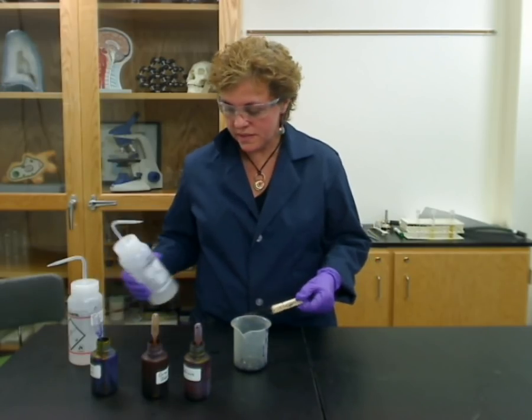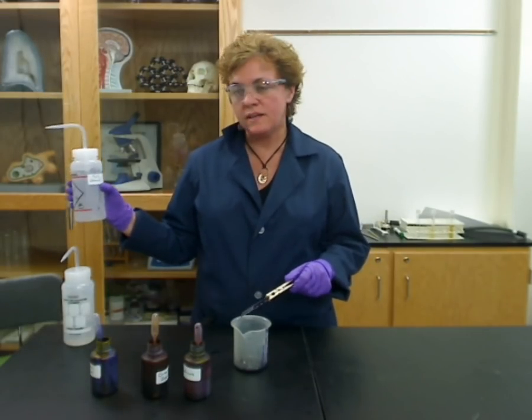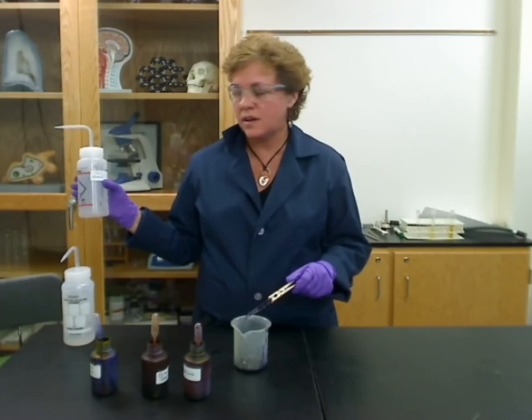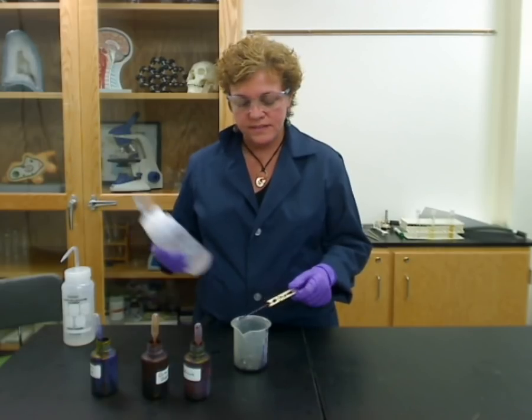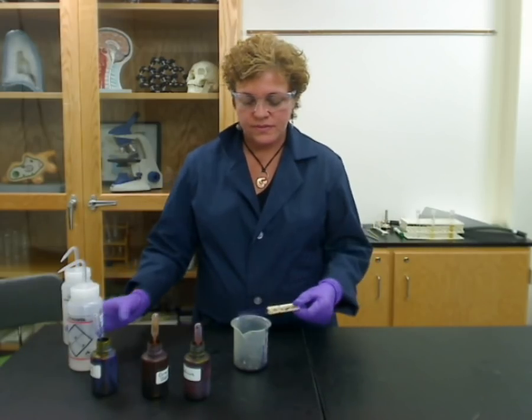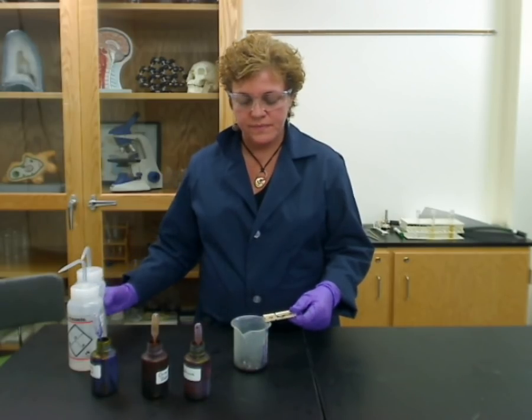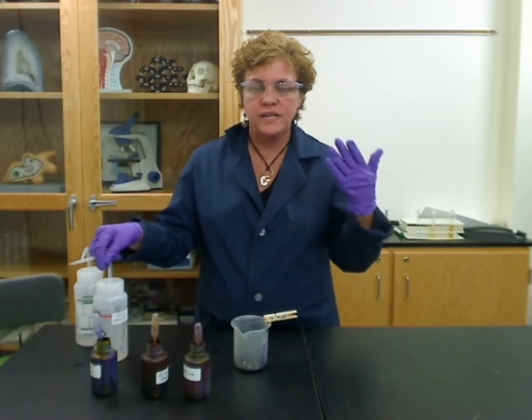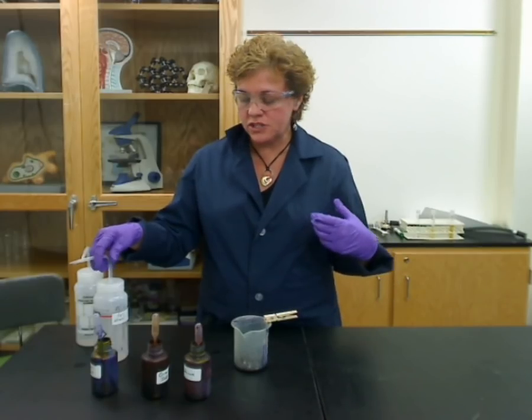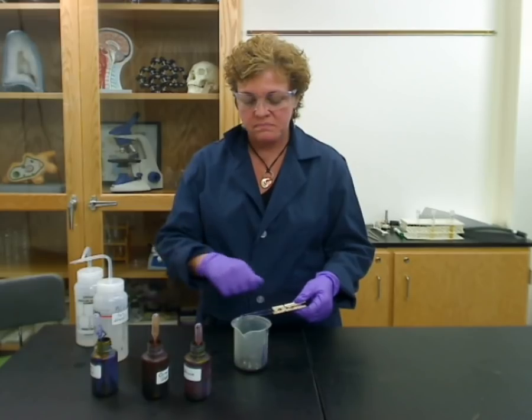You need to get rid of the iodine, rinse it well with water, and probably the most important step is the decolorizer. In this case we're using 95% ethanol. You can also use a combination of acetone and ethanol. You have to put a few drops on until the purple goes away, but just barely, and then rinse it quickly with water. It's really important that you don't use too much decolorizer, because if you do, the purple that would have stuck gets forced off. Just put a few drops until there's not a really dark purple coming off — probably three squirts and you're done.